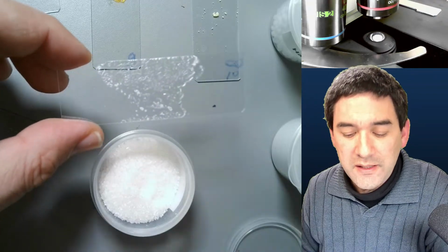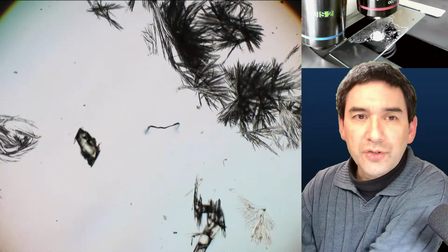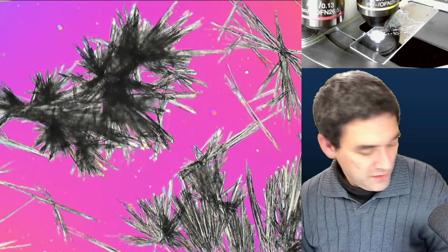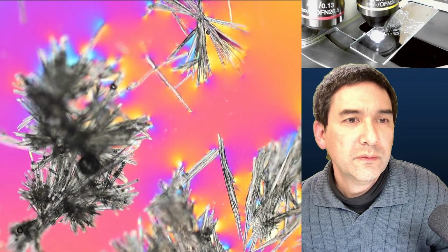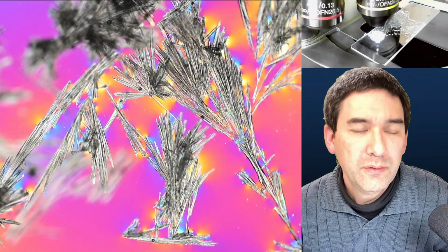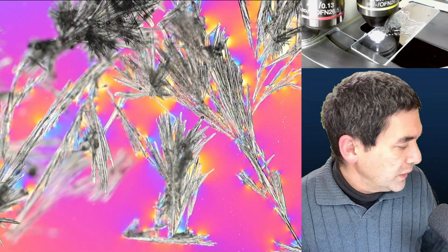So this is basically salicylic acid, which is the active substance of aspirin, which is also known to make very nice and fine crystals. Maybe we can try this a little bit, to see how well it dissolves in water in comparison to alcohol. Again, a little amount of water I'm going to add. Okay, here we go. So that is with added water, and you see, the crystals seem to remain largely intact, even though they are so fine, because it evidently does not dissolve very well in water.